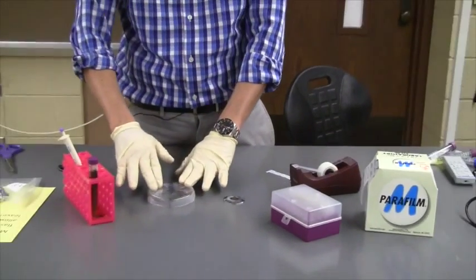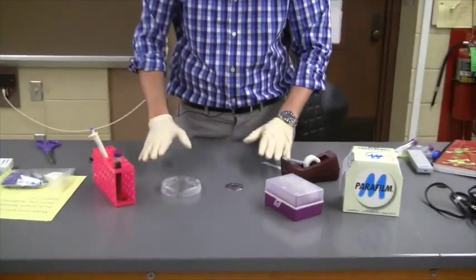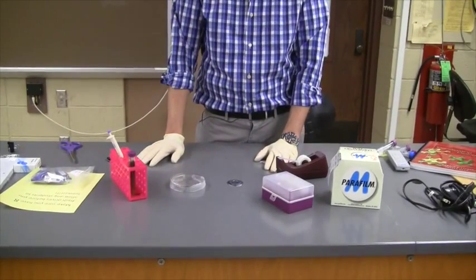Make sure it's properly labeled with your group number and the day of your lab and give it to your TA to place in the incubator.